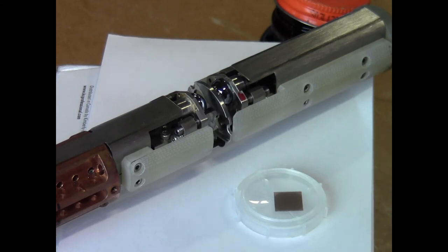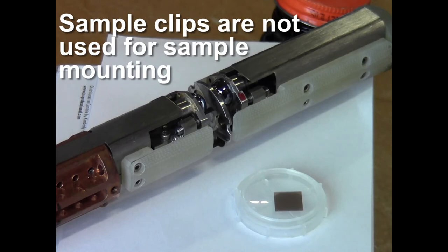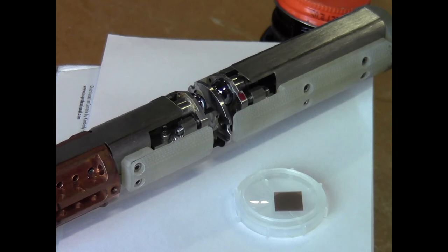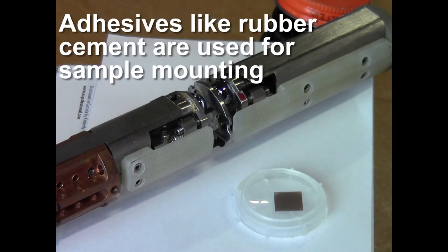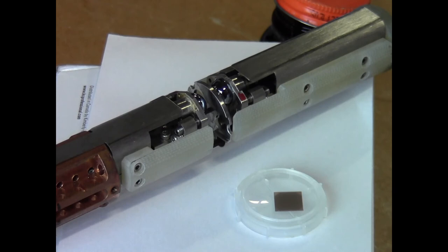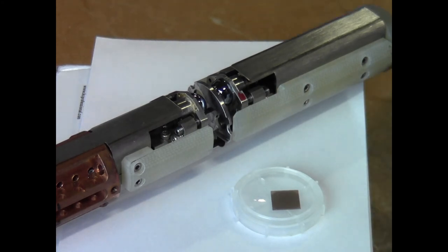Due to the nature of the varying degrees of different kinds of materials that are used, we decided to not use sample clips in the environment. One, because they add some size and bulk to the insert. And two, because a lot of materials that are used by researchers are actually quite brittle, and so a universal sample clamp can be detrimental to a large number of different kinds of samples. The technique that we use for sample mounting is just a little bit of rubber adhesive. This is just a common adhesive. It's cryogenically compatible, it hardens up nicely, and its purpose is really just to hold the sample in place. The sample is going to be cooled by vapor, so we're not really using any conductive cooling to get the sample to temperature. So all we really need is a little bit of adhesive to hold that sample in place while we do our stick transfer into the cryostat. Sample mounting is quite straightforward.